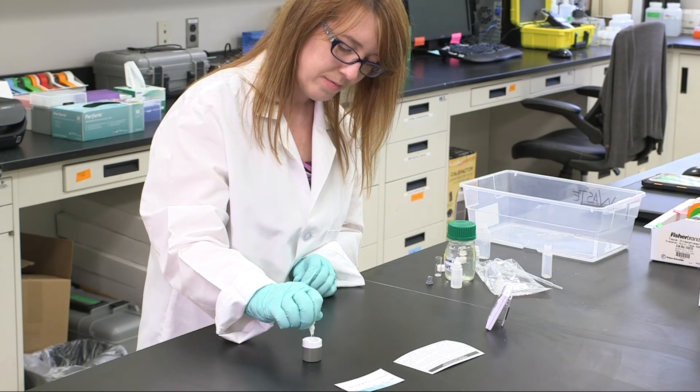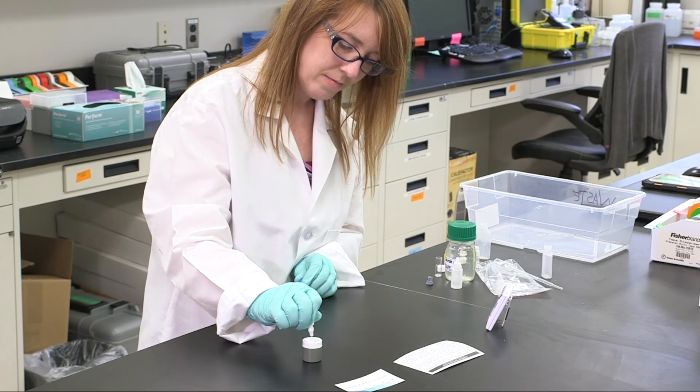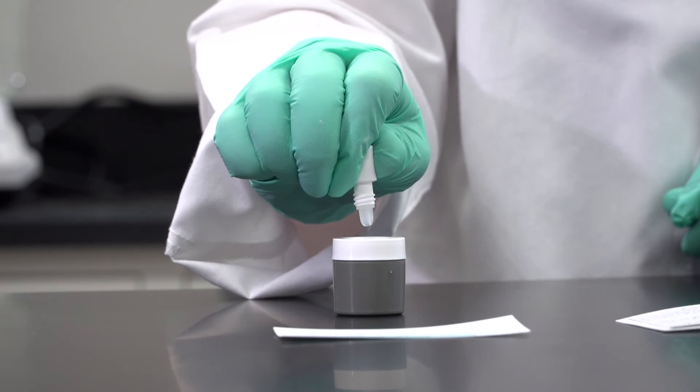Squeeze 10 drops of stop solution onto the membrane to stop the color development. Refrigerate if long-term storage of development is needed.